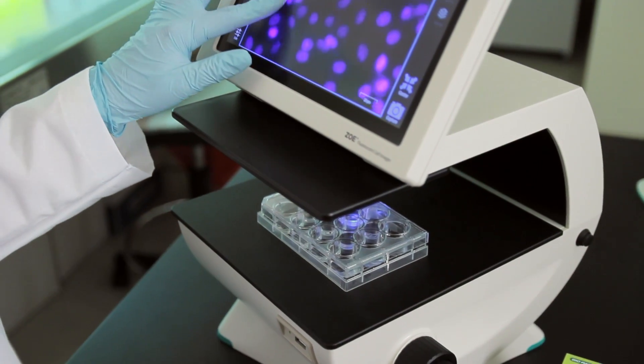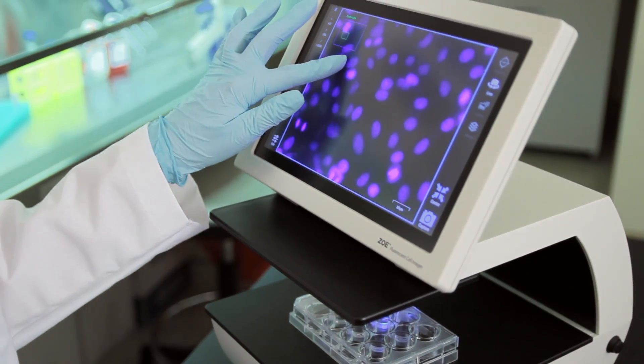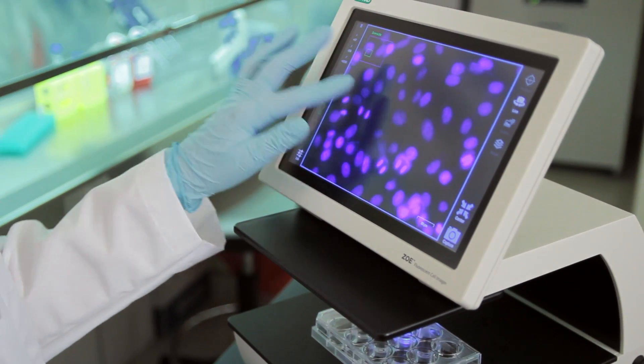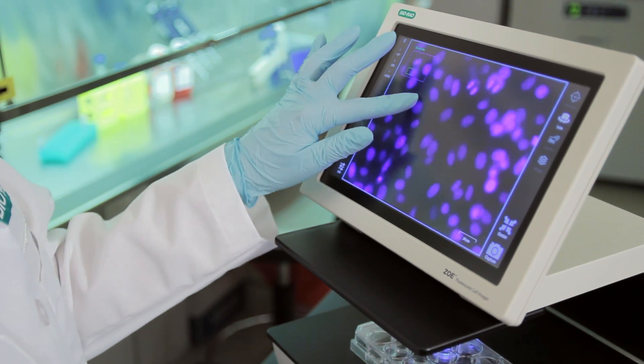Now, image your samples with the ZOE Cell Imager. The nucleus will fluoresce in blue for easy detection of your fixed cells.